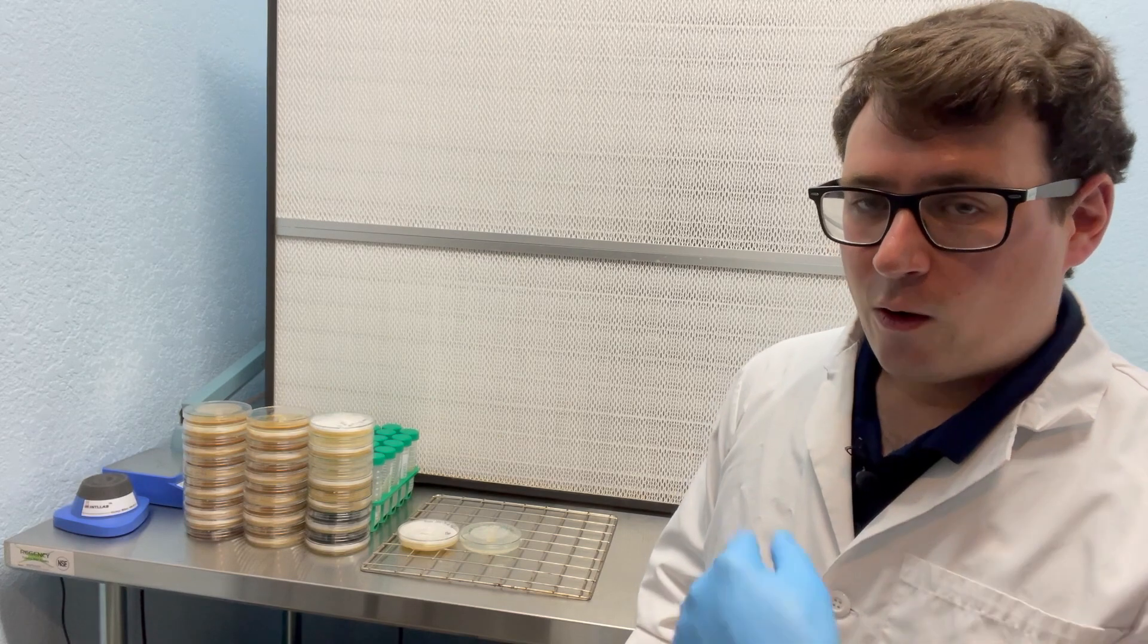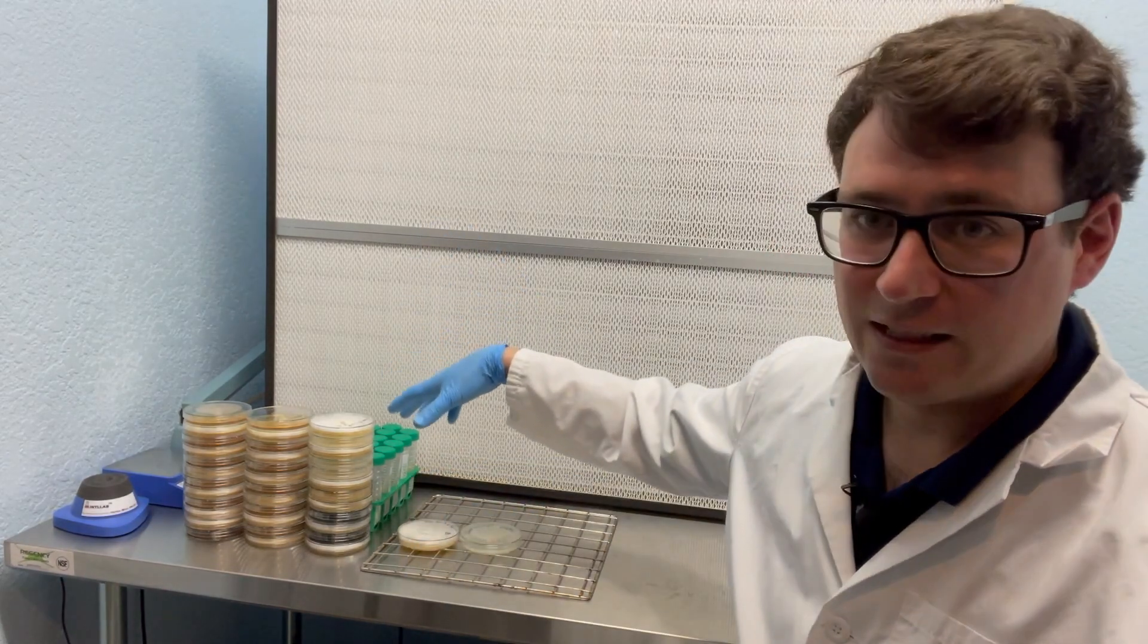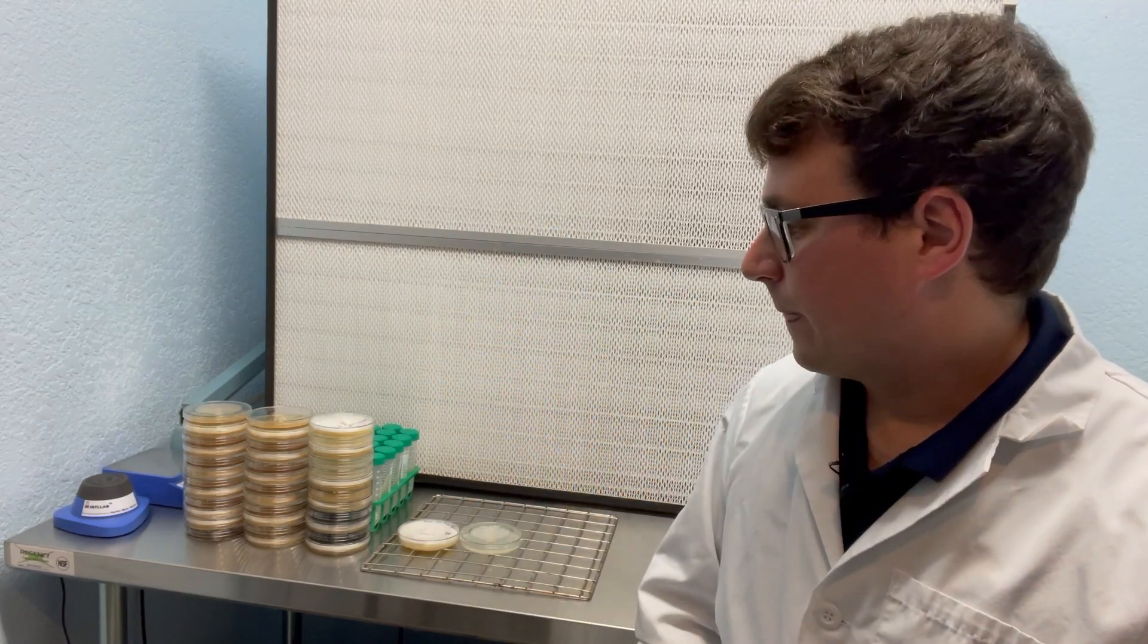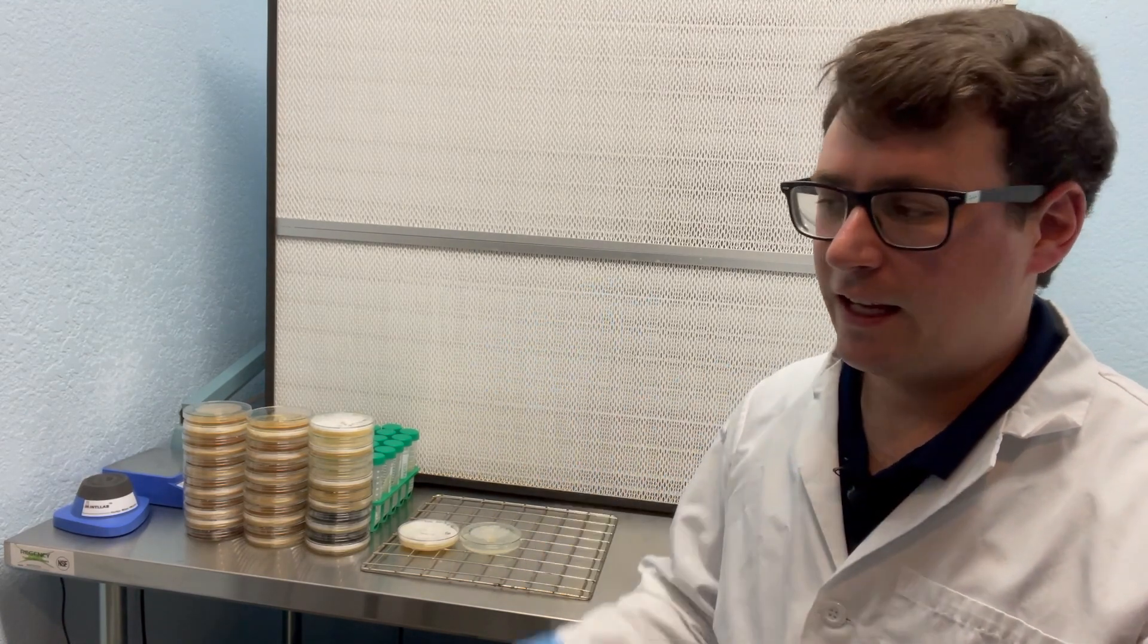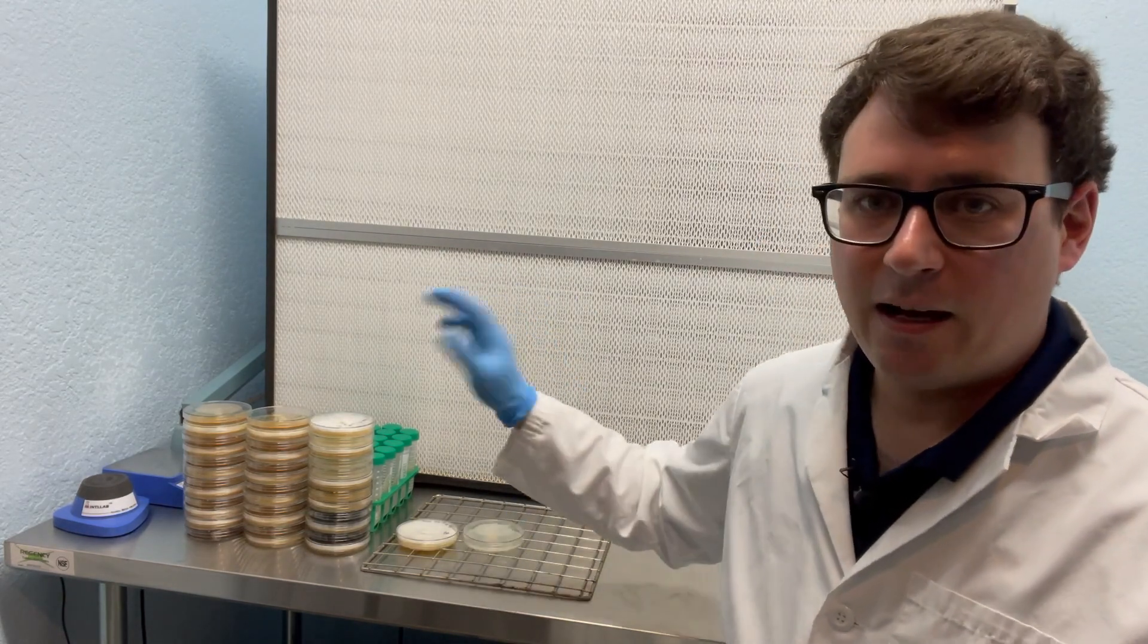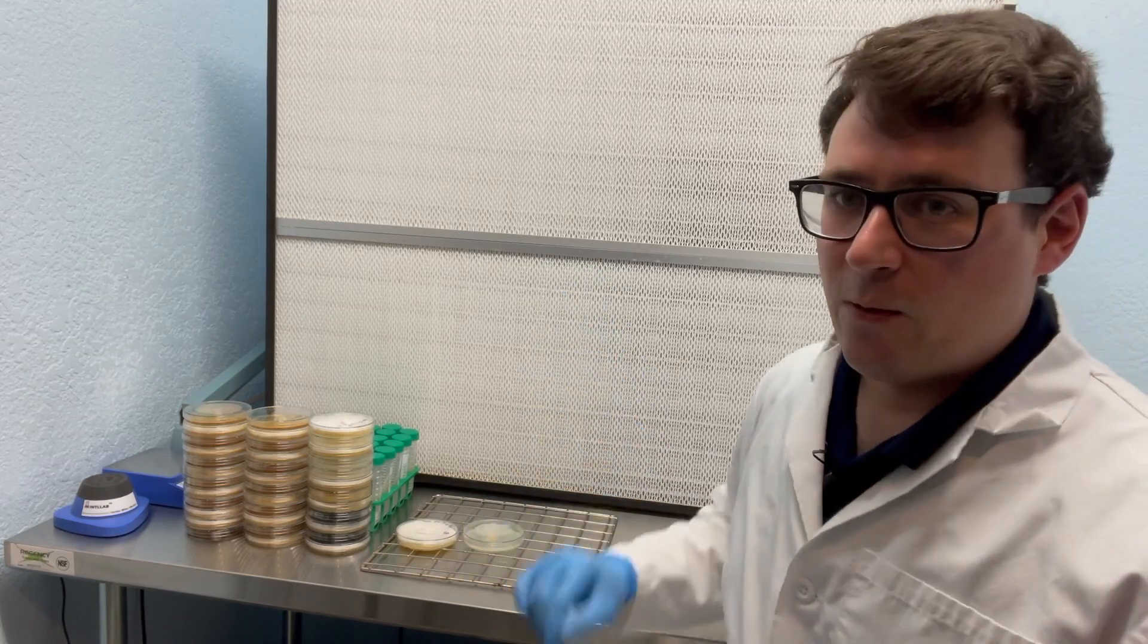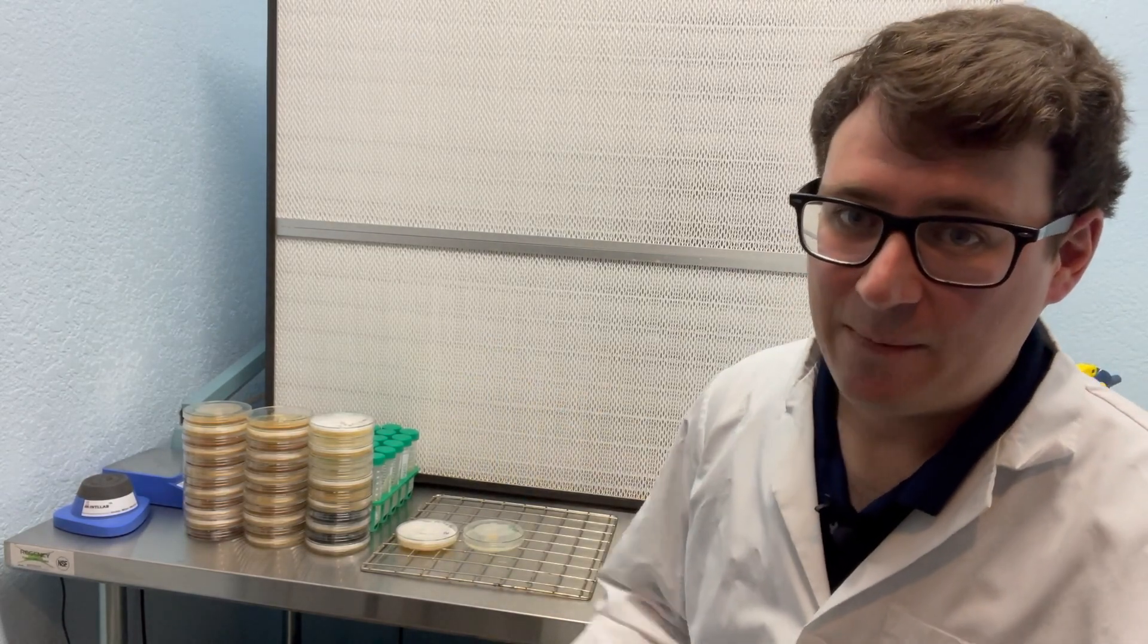So I'll be going over that at the end of the week and then I'll keep you guys posted. Hopefully we get some really nice fruits. There was one weird looking plate that kind of had multiple areas of inhibition, so I feel like if there's any kind of sectoring that happens on the next petri dish, then maybe it was already a mated pairing on that initial isolation. It's hard to say without fruiting, but you can understand the process by watching this video. All right guys, I'll parafilm these, flip it around. And until next time, mush love.